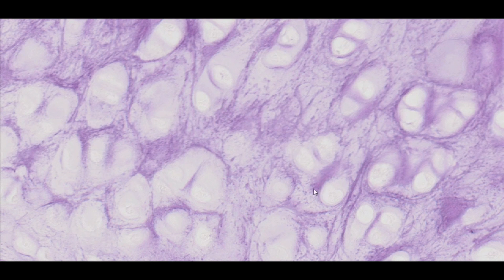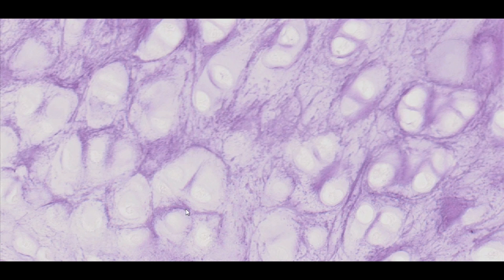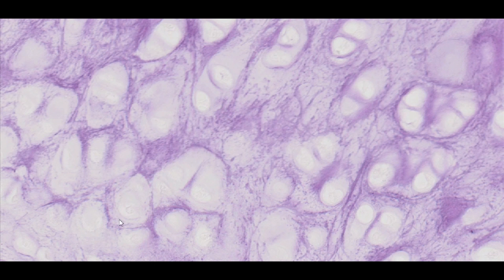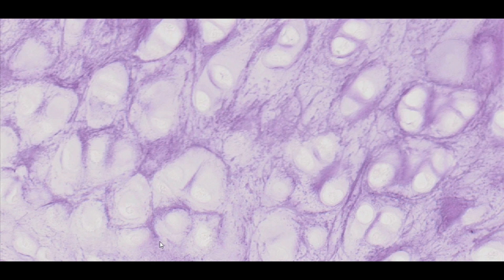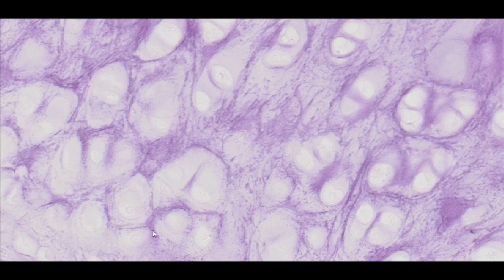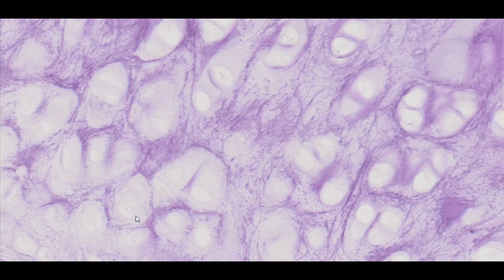The isogenous groups of the presented cartilage are smaller than those of hyaline cartilage, and the chondrocytes they contain appear to be larger. The presented section was stained with resorcin-fuchsin to visualise elastic fibres, which remain invisible when using routine histological staining. However, this method fails to show chondrocyte nuclei and thus identify cartilage cells.